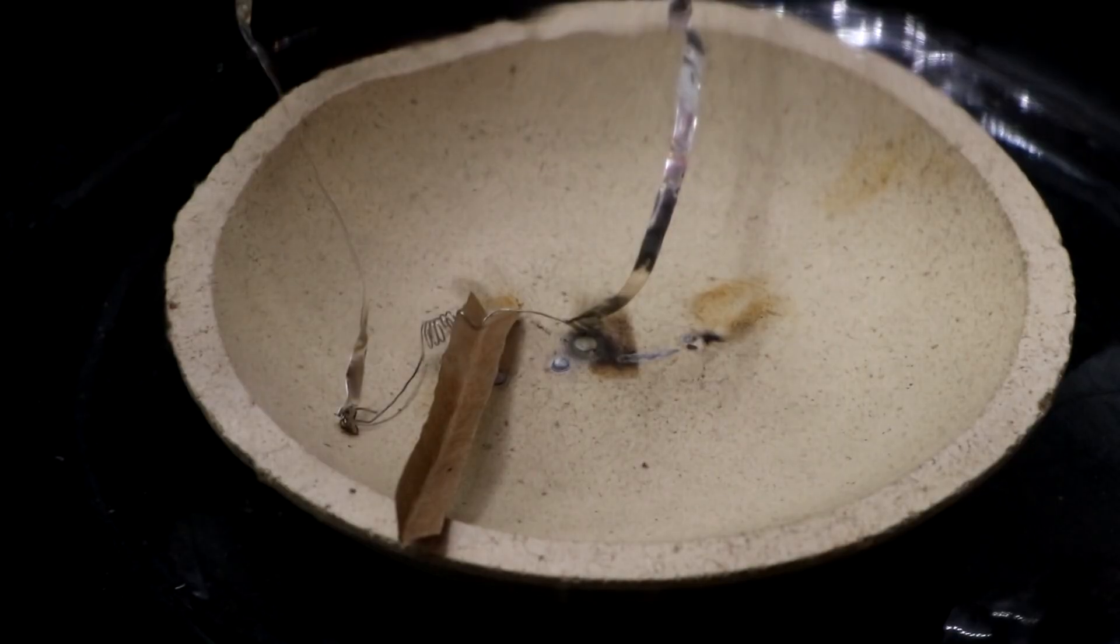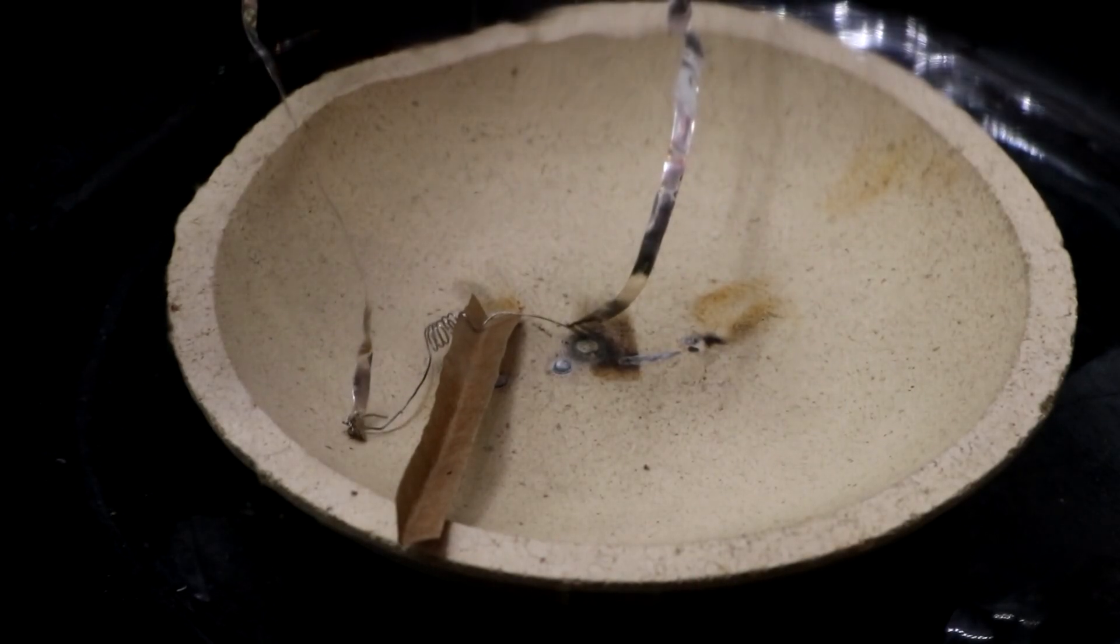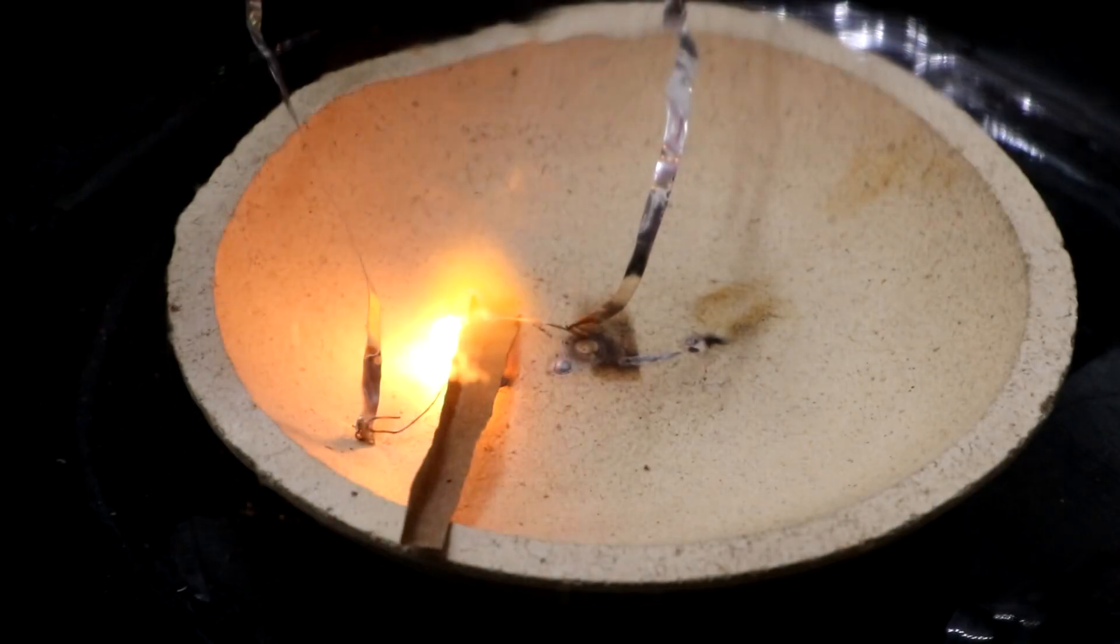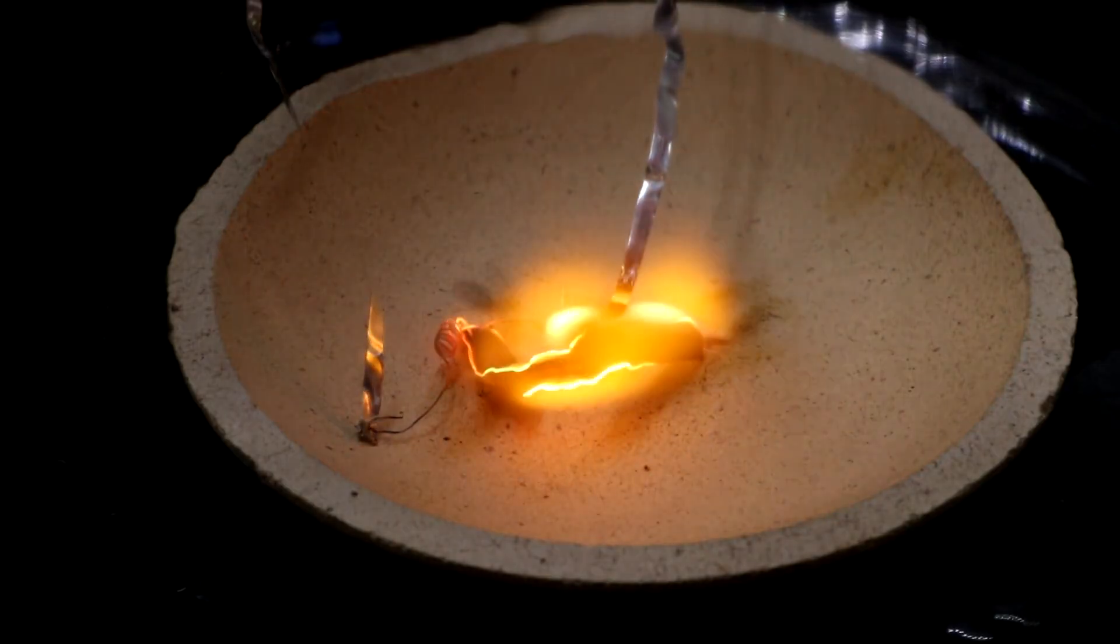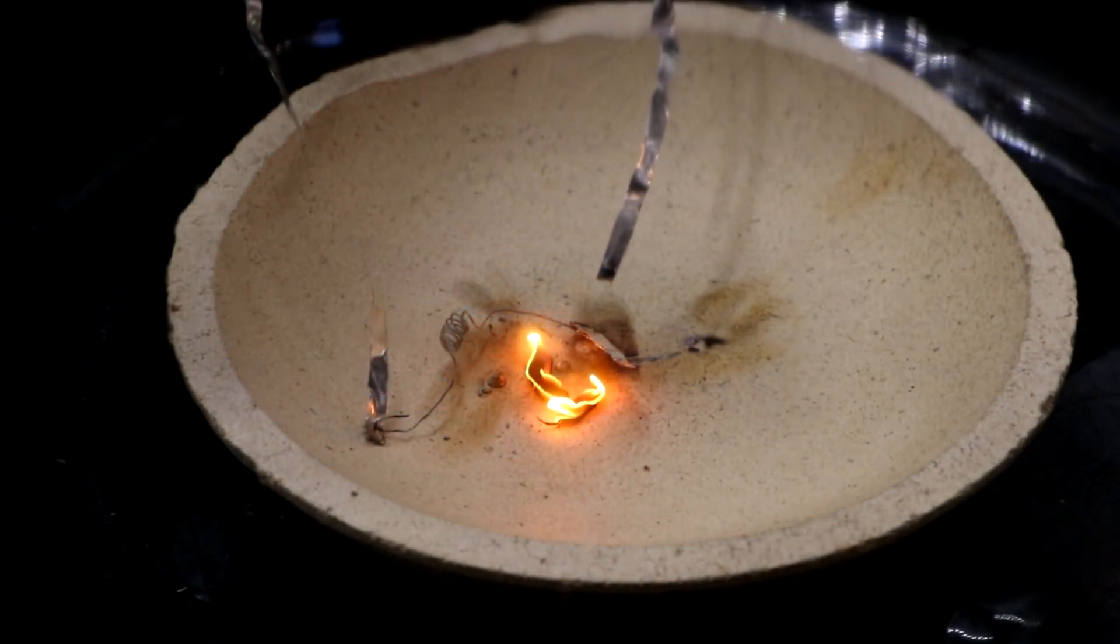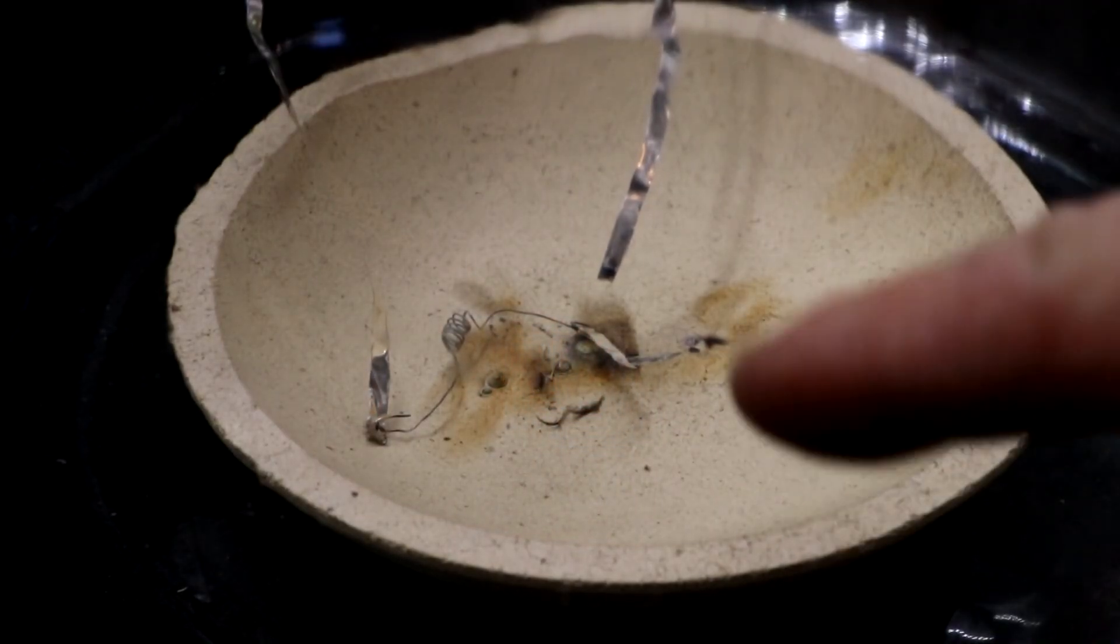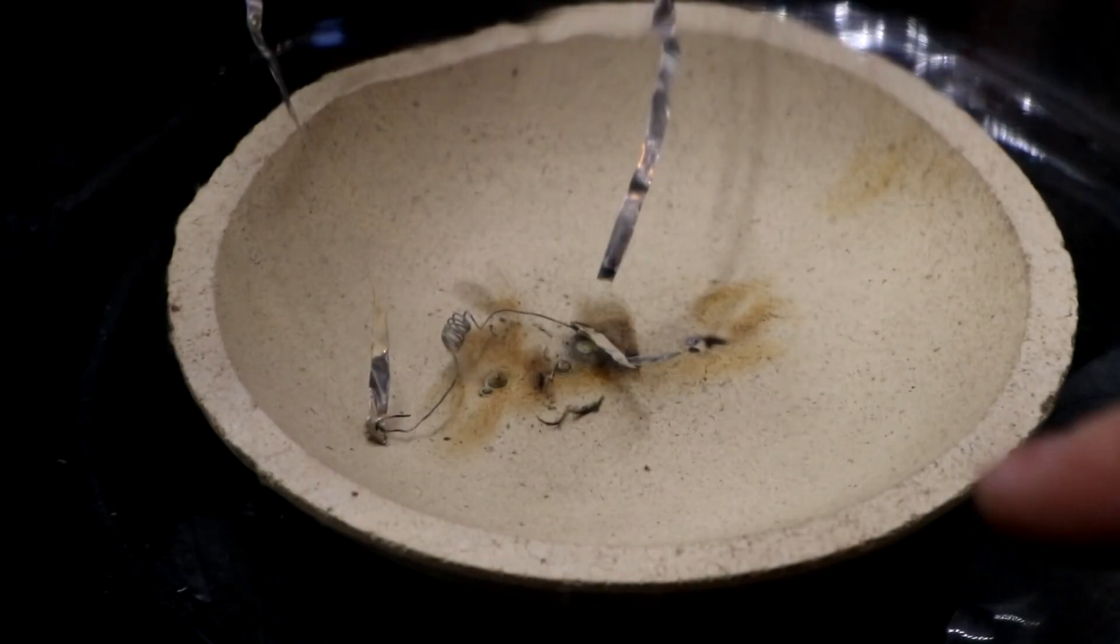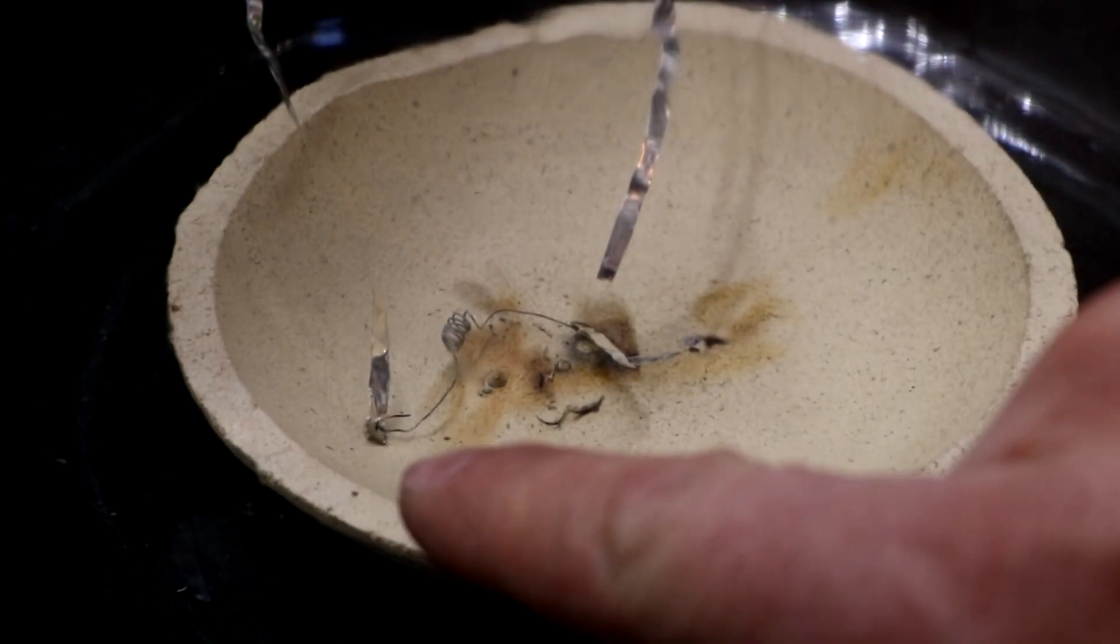Let's ignite it. So that is still faster than it burned in the open air. It burned more completely. You can see it melted my silver, but the resistance wire is still in place.